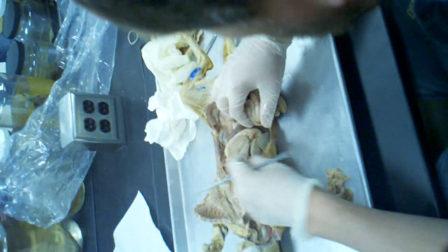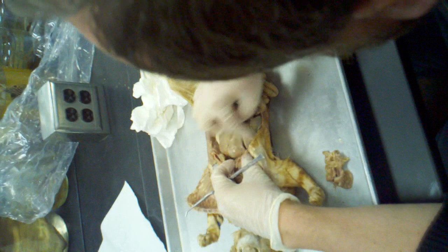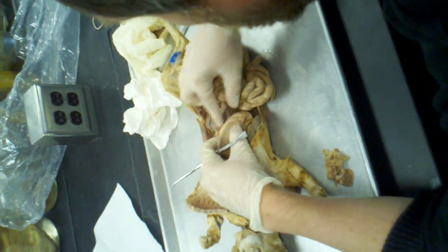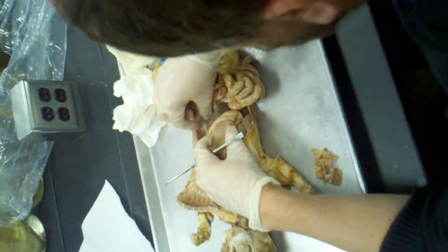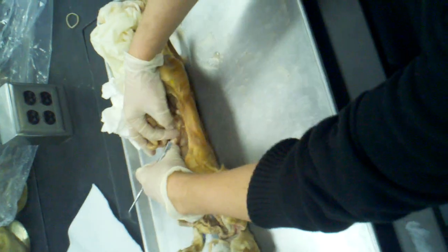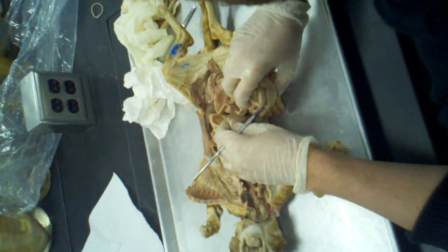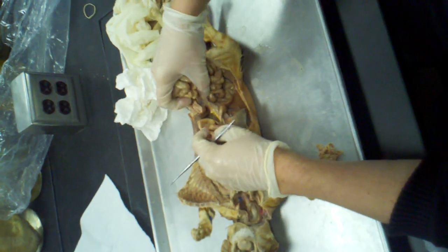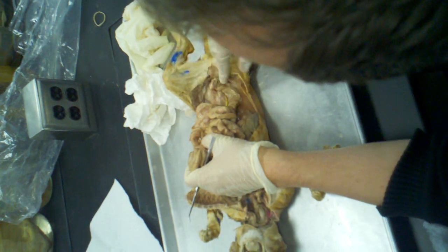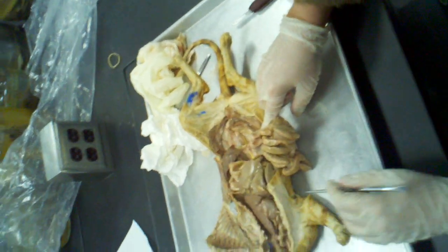Okay, now let's go into the peritoneal cavity. Of course, we've got the liver with the multiple lobes. We've got the stomach. We've got the spleen here. We've got the kidney here. There's one on the other side as well, down here, generally colored blue. It gets a little more tricky down here. You've got intestines, large and small intestines, and then down here, you've got the single urinary bladder.